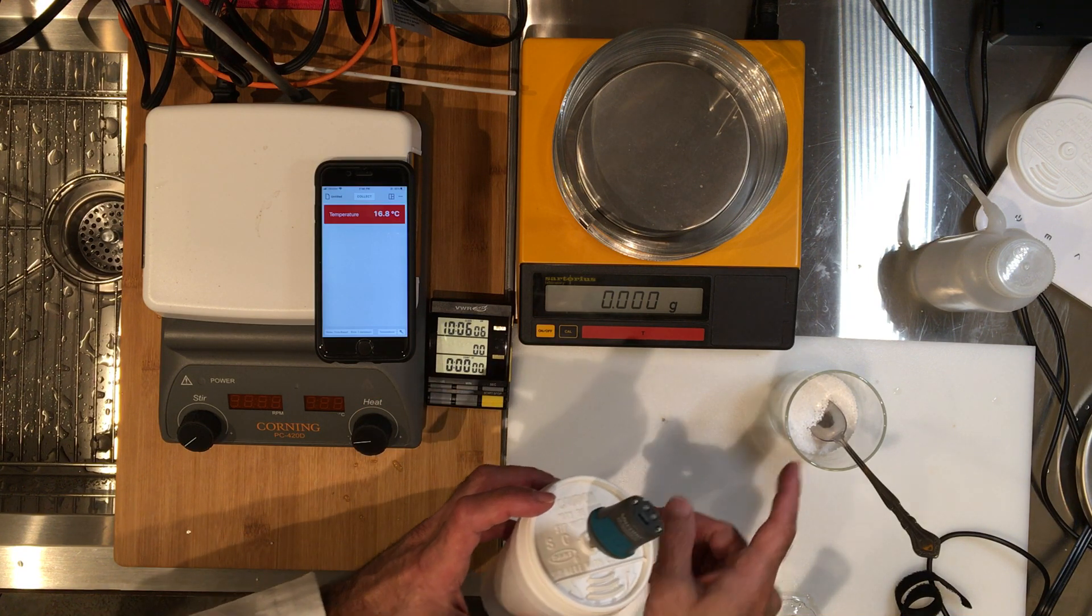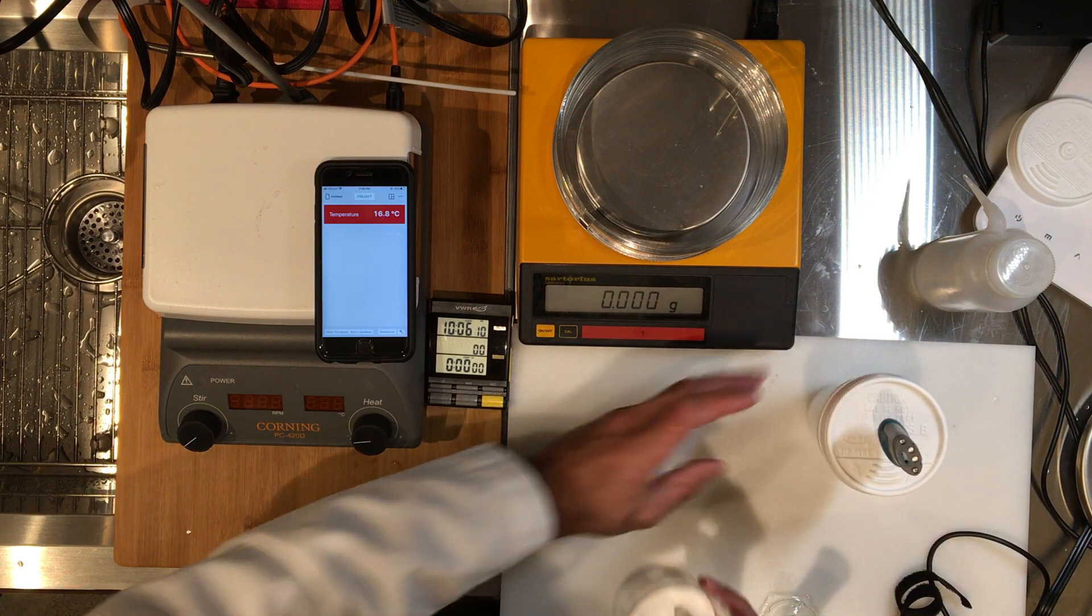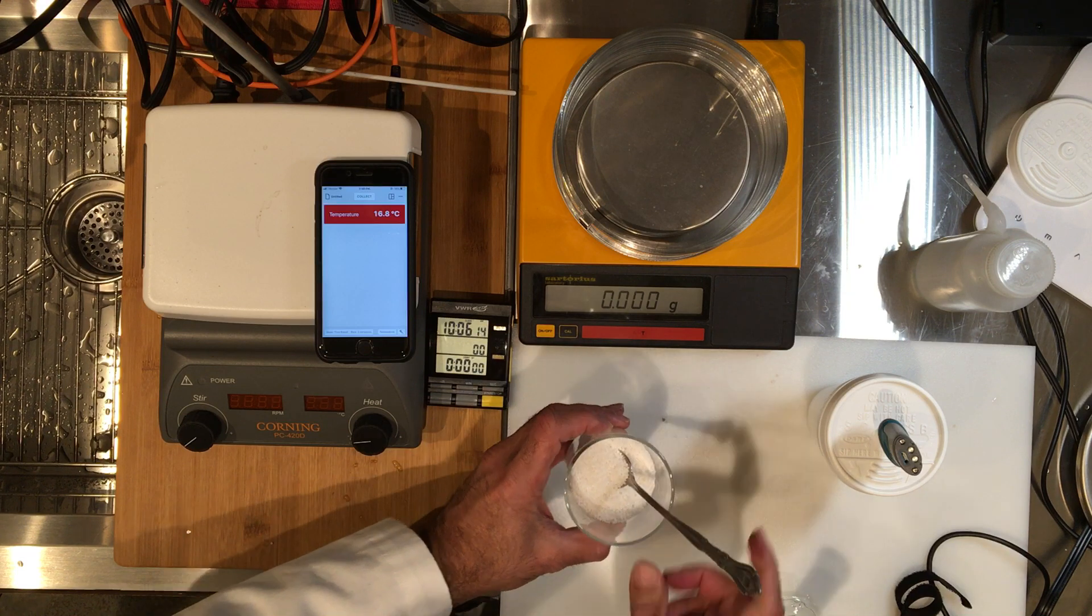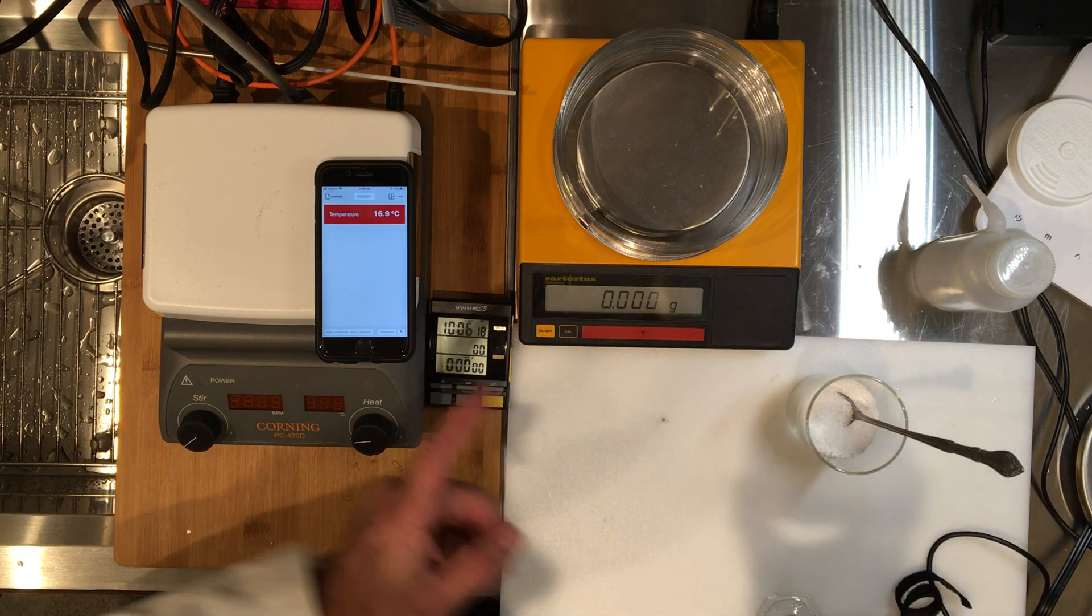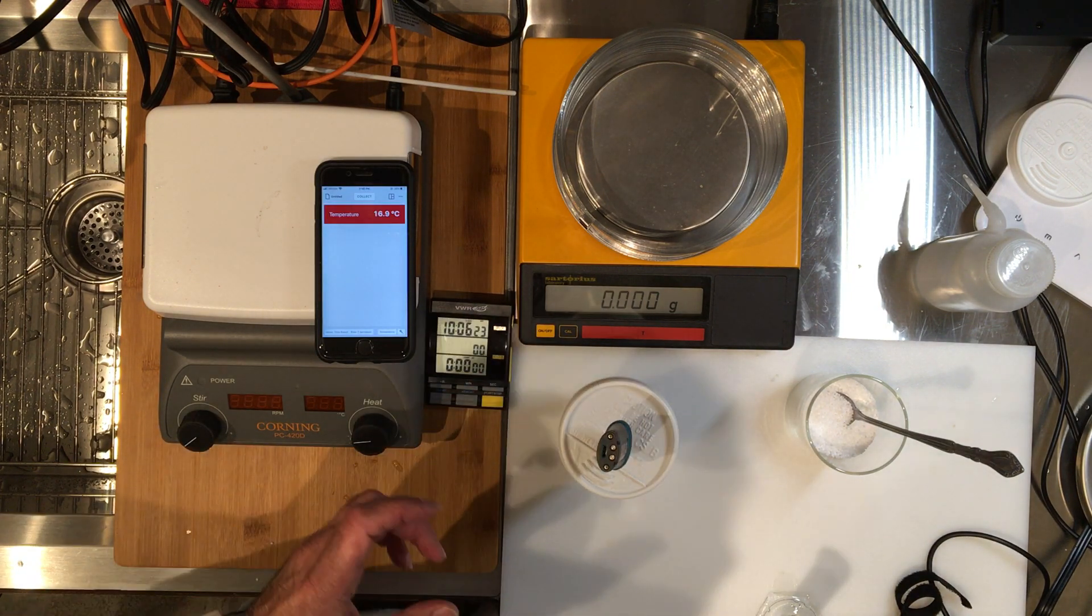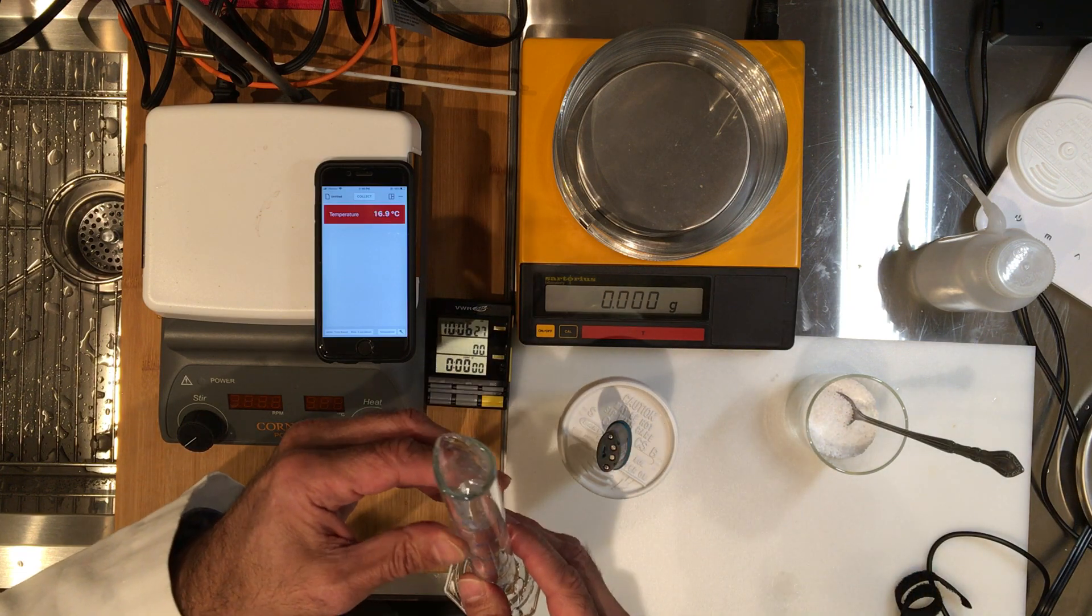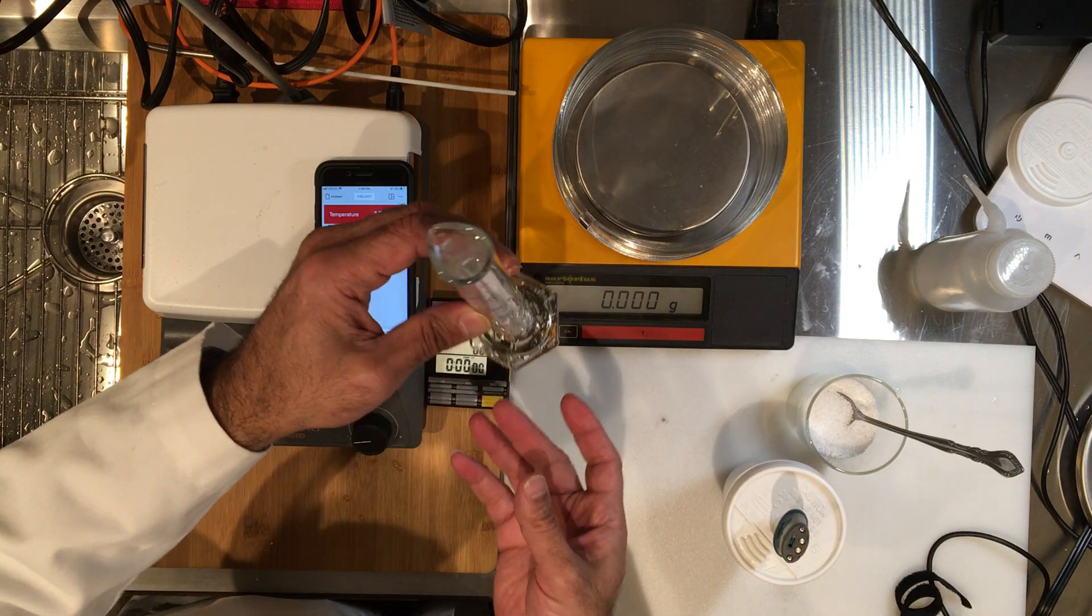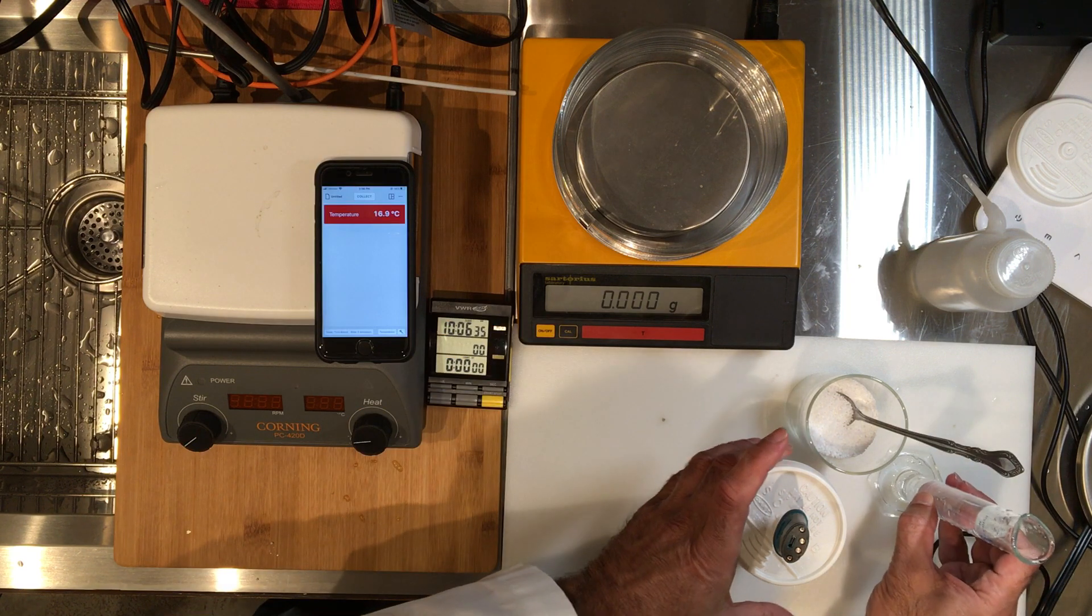There is my ammonium nitrate that I've emptied out from the cold pack, so I'm going to take essentially just like one spoonful, but we need to measure the mass. The idea is to measure the mass and we're going to work with the masses of everything. So let's first get the mass of water to dispense out the approximate right amount of water. I've basically taken 50 milliliters of water, and mass is more important.